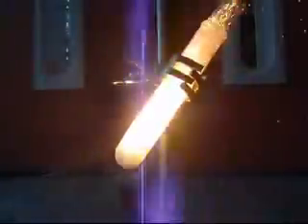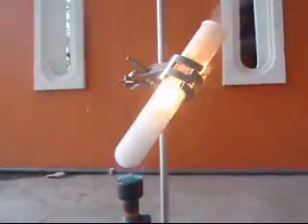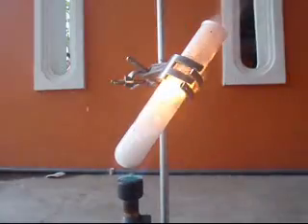Wow! A violent reaction occurred, producing a lot of carbon dioxide and water vapors. It also creates a shower of embers.